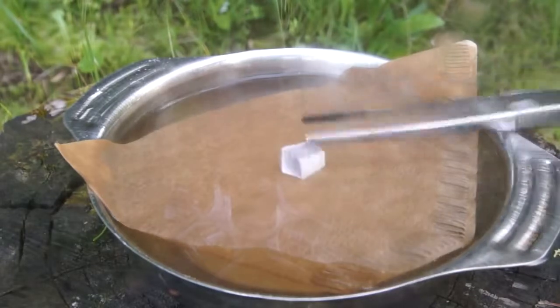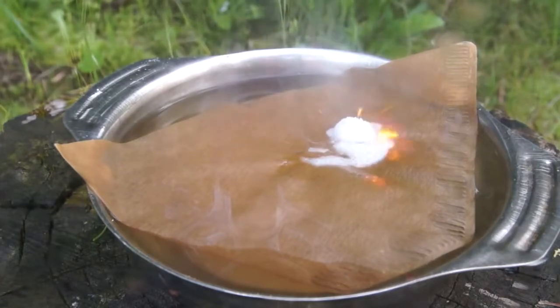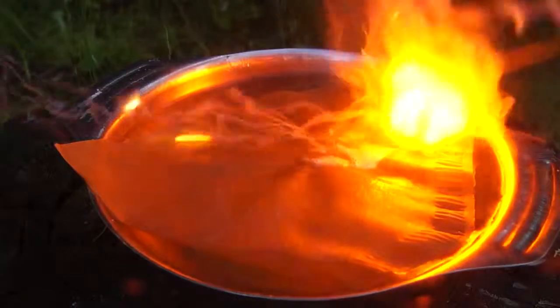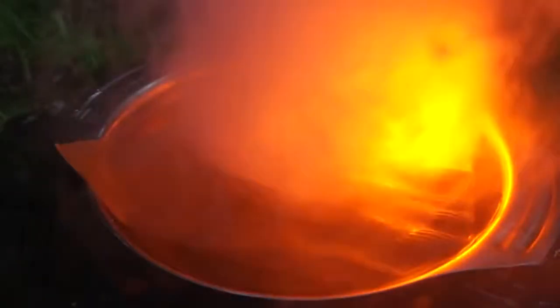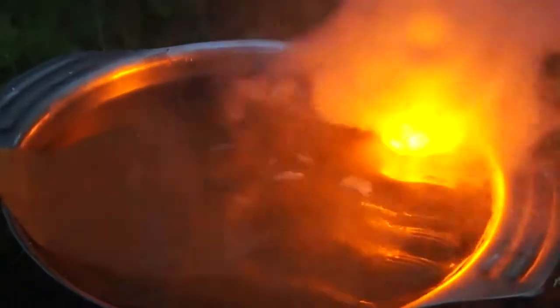I wrote to the authors of this article about the effect that I was able to photograph. They first answered that we could be dealing with transparent sodium hydroxide. But the question remains: why did this drop float and not sink? Perhaps because of the temperature difference between the droplet and water, we are dealing with the Leidenfrost effect, which we can observe by pouring liquid nitrogen on a hand. I even spoke to Professor Thomas Tom at Tallinn University, who is working in the organic chemistry field. He suggests that perhaps we are not dealing with pure sodium metal or sodium hydroxide, but instead with some kind of phases that sodium hydroxide can form with water — and due to the special optical properties of this drop, it becomes transparent.